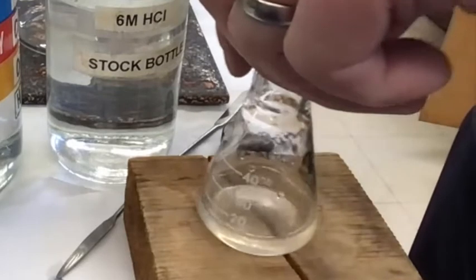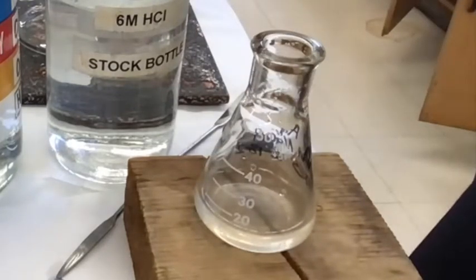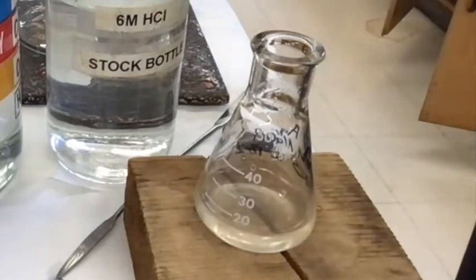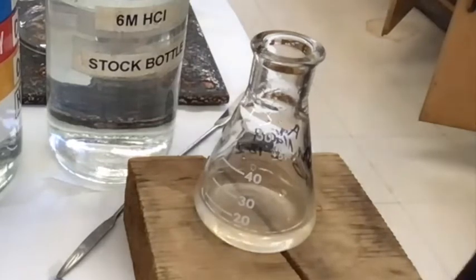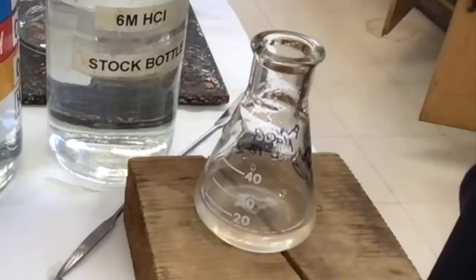That's the local high concentration of HCl protonating the carboxylate into the carboxylic acid, which is precipitating out. But then once you swirl it around, it mixes in with the rest of the sodium hydroxide and deprotonates it again, turning it back into the carboxylate.